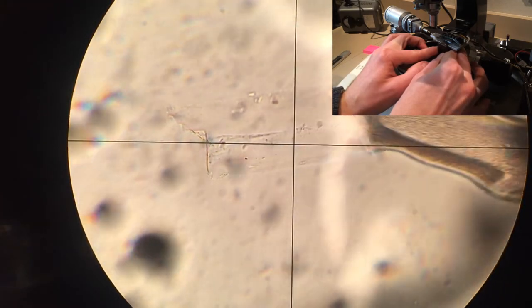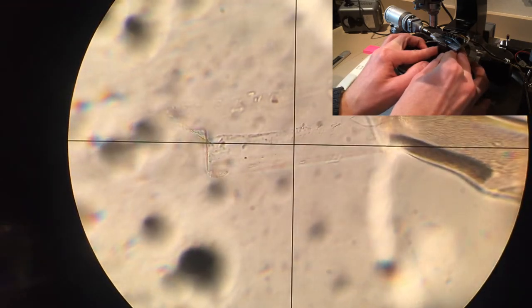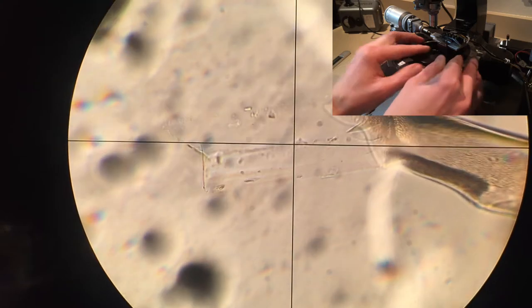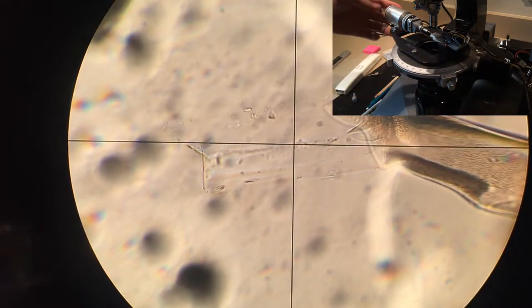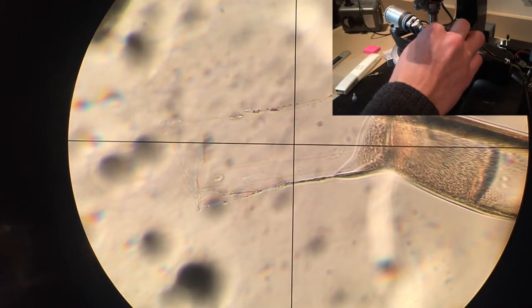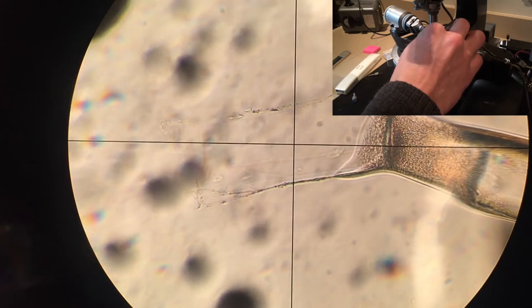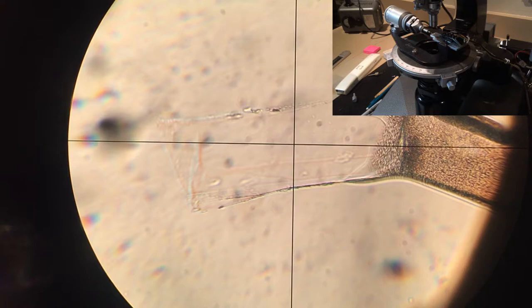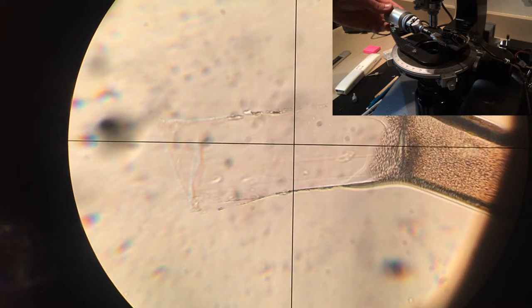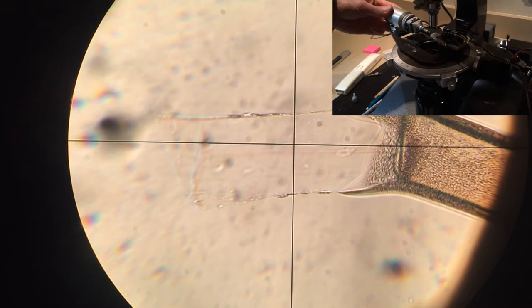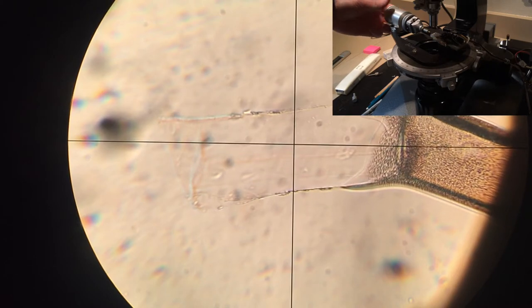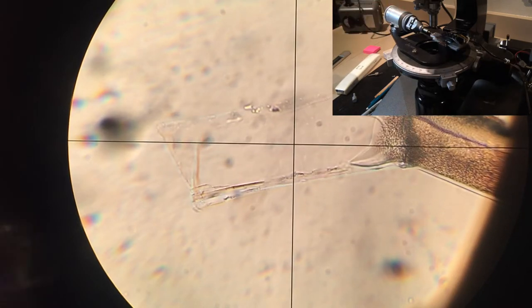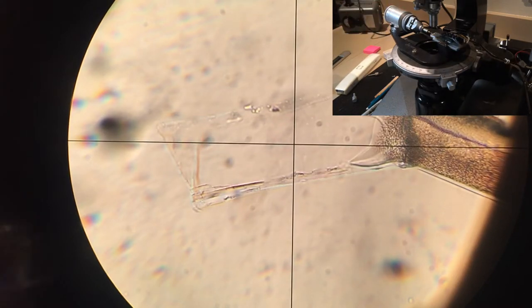We're going to immerse that and hope that it's pretty near a match. It looks a little bit junky here, but you can see that the crystal is much harder to see now because it's relatively close to the refractive index of the crystal here. The crystal is close to the refractive index of the liquid.